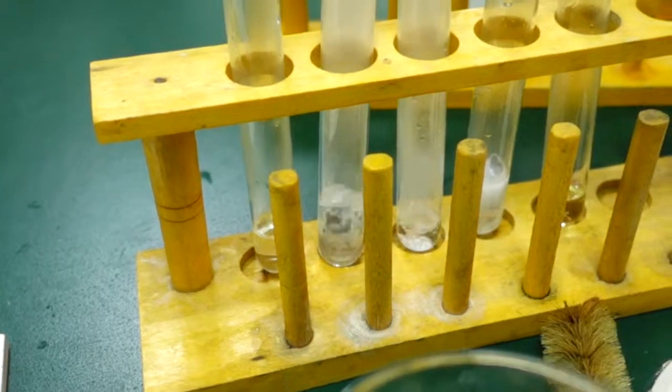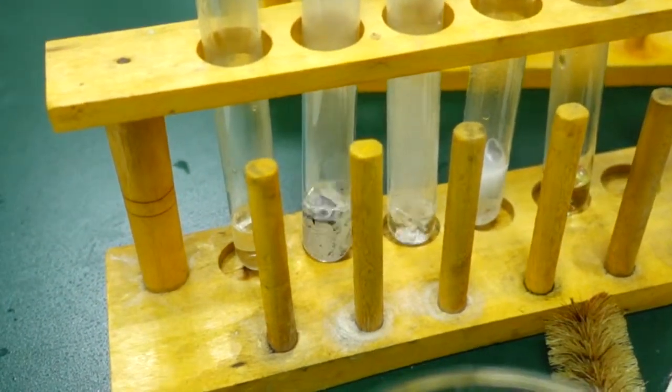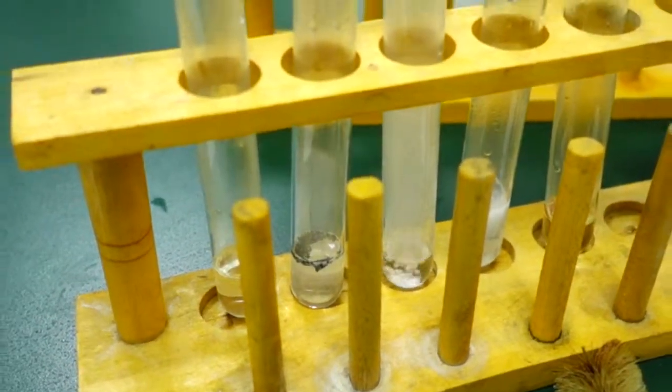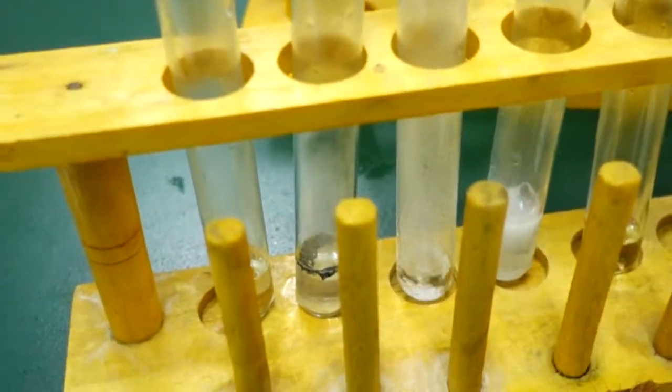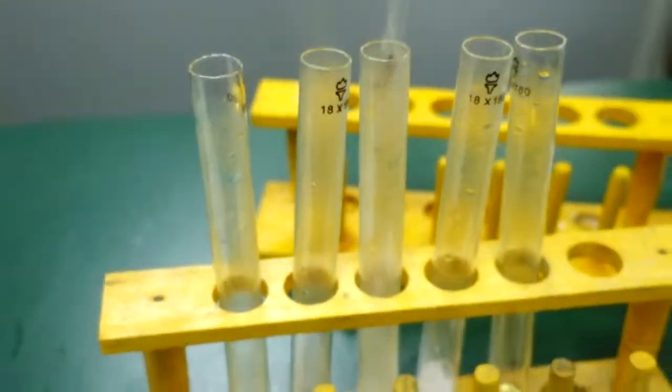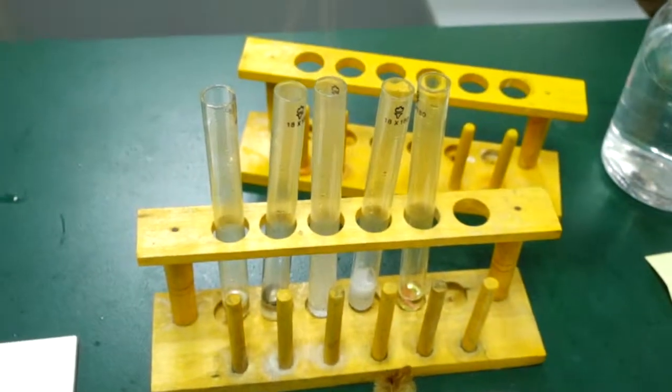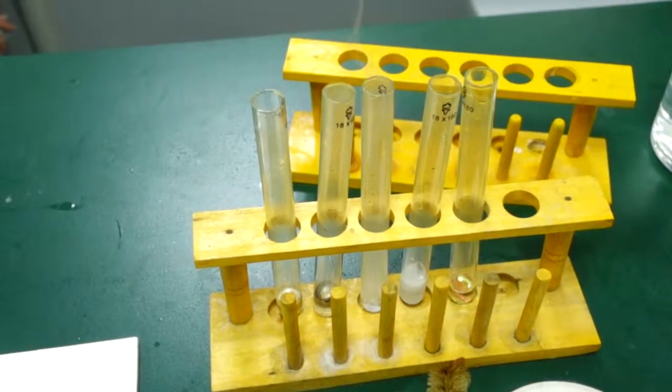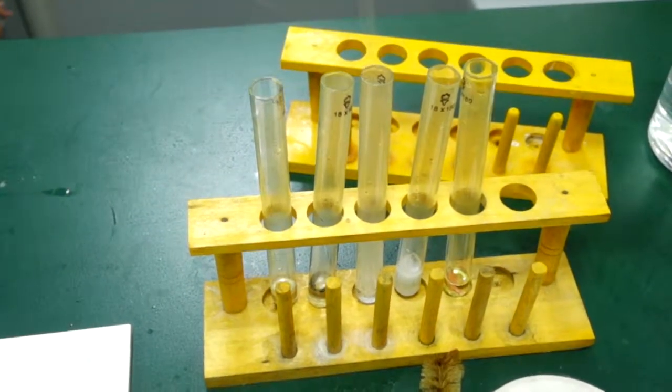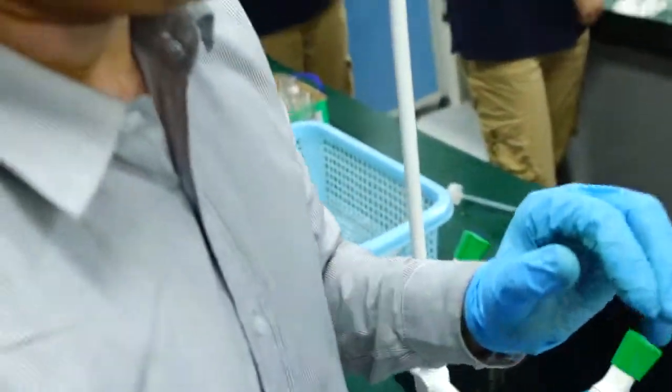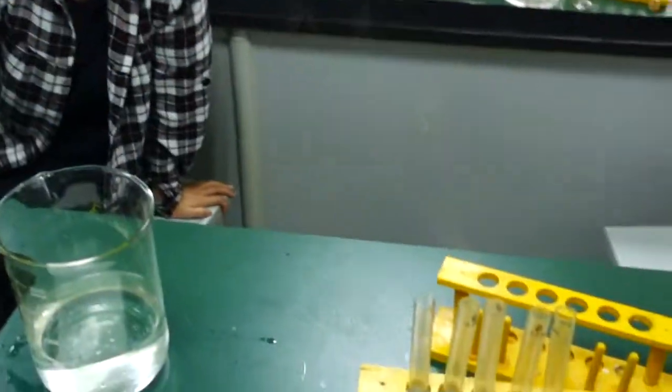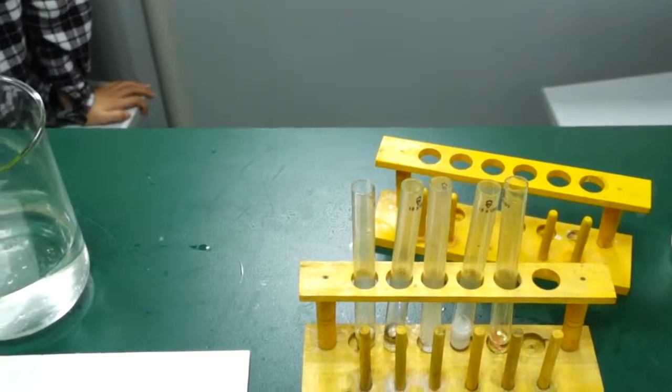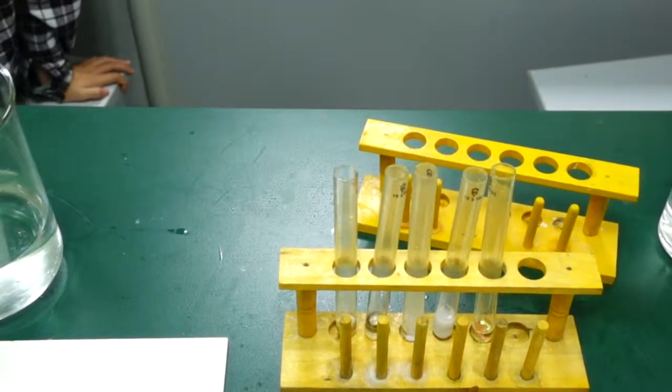Oh very strong! And because that's so strong, that tells me don't use metal E. I am not using metal E. These are not boiling tubes, they're not designed to get very hot. If you have any doubts in science, don't do the experiment - talk to an expert first. I don't know if that tube is designed for that kind of temperature. It may spit acid as well, and that acid is very strong. We don't want that to happen.